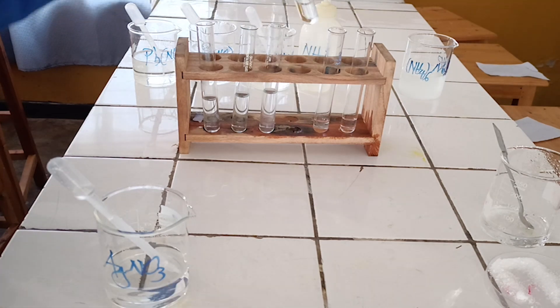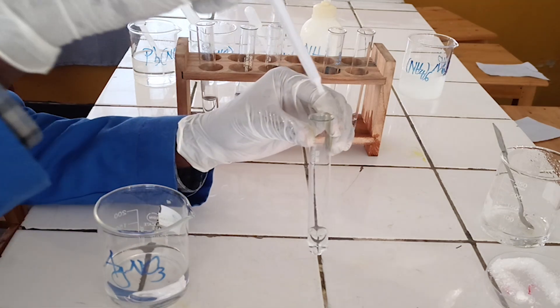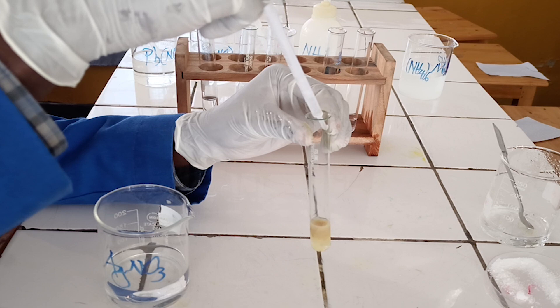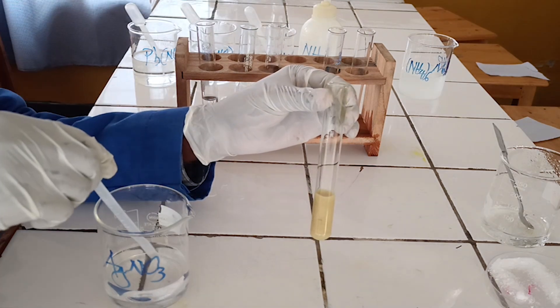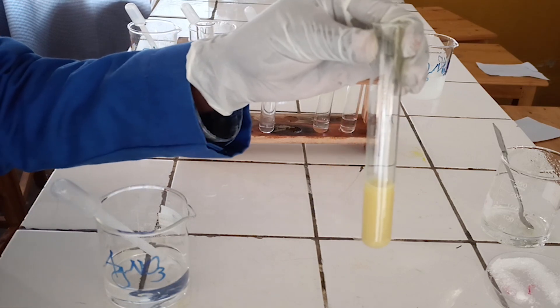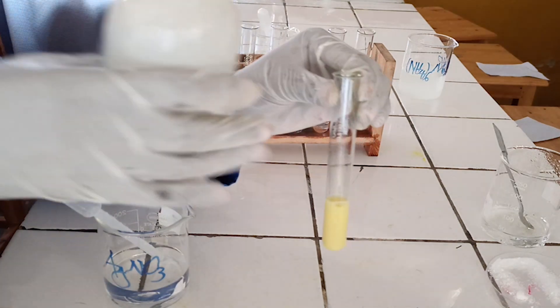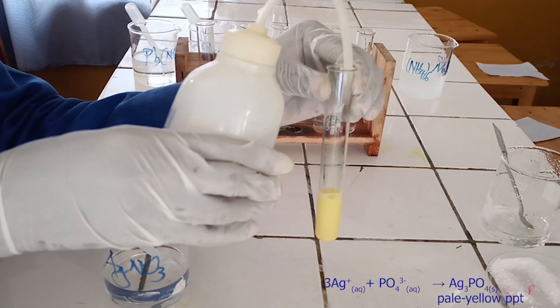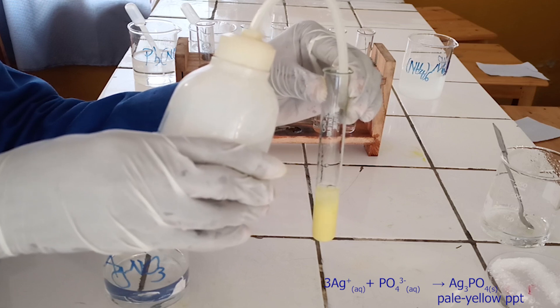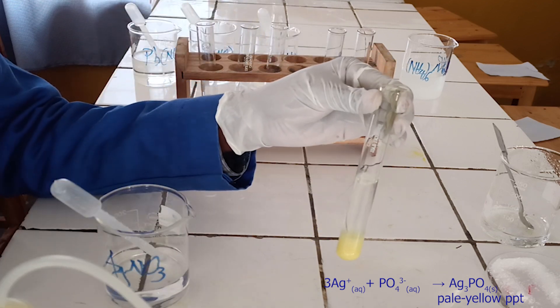To the fourth test tube, add silver nitrate solution followed by excess of diluted ammonia. As you see, silver nitrate solution reacts with phosphate ion to form a pale yellow precipitate. The pale yellow precipitate formed is soluble in excess of diluted ammonia.